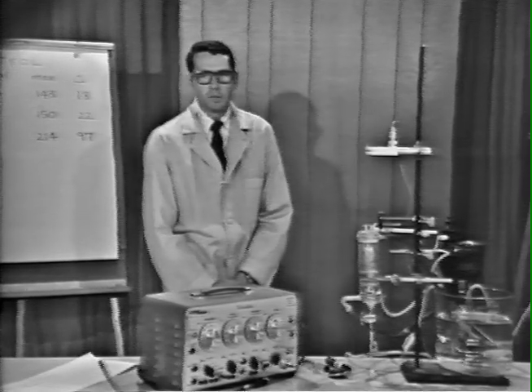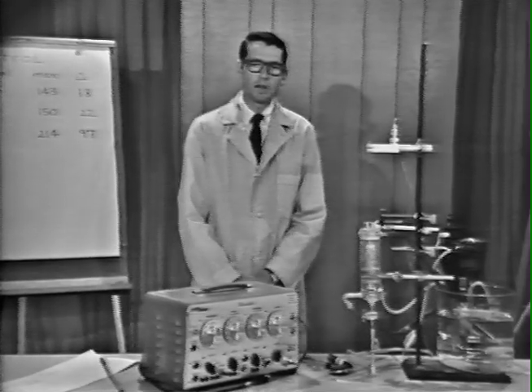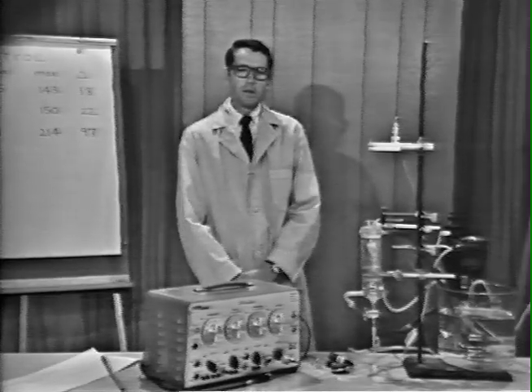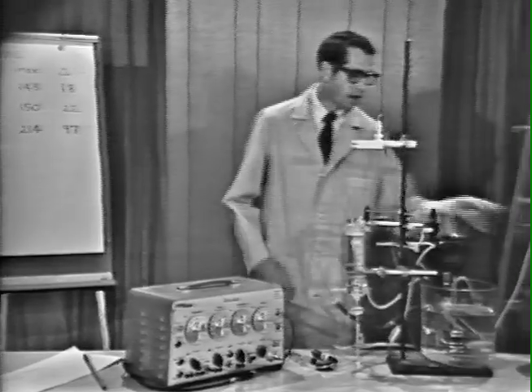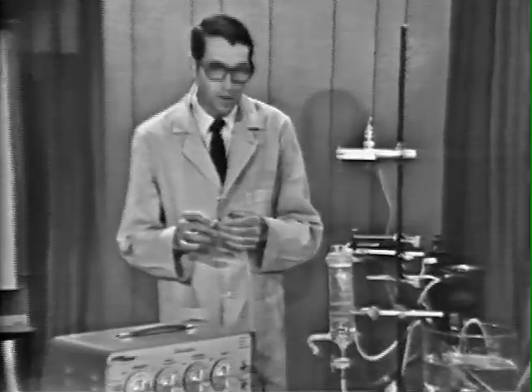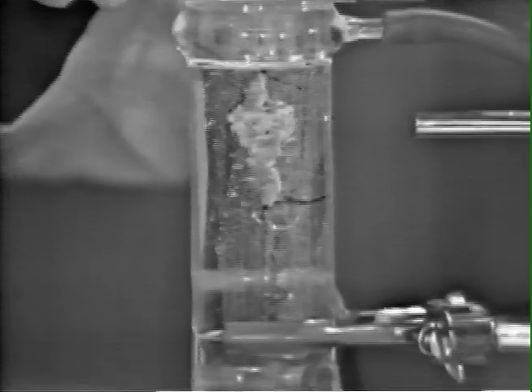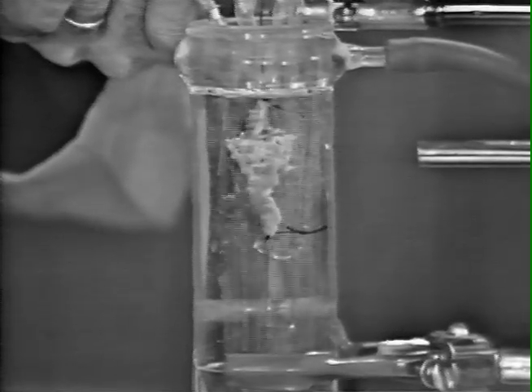The preparation has been exposed to cocaine now for about 40 minutes. The cocaine is in a concentration of 1 microgram per milliliter. We're going to start the injections of the amines then by giving, again, tyramine at the same concentration as we did previously. We will again inject the tyramine directly into the tissue bath. The tyramine is in now.